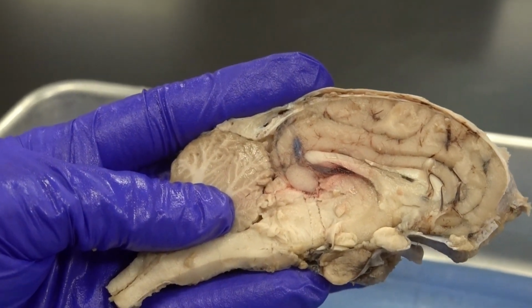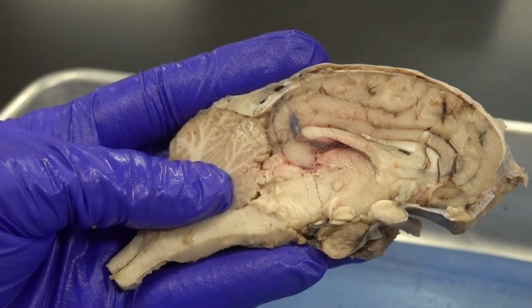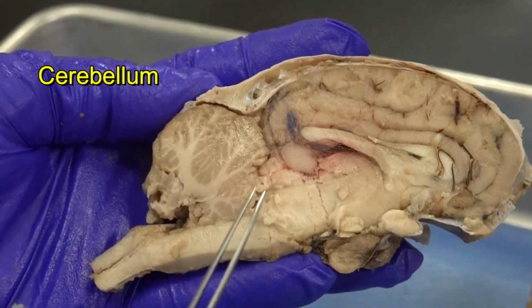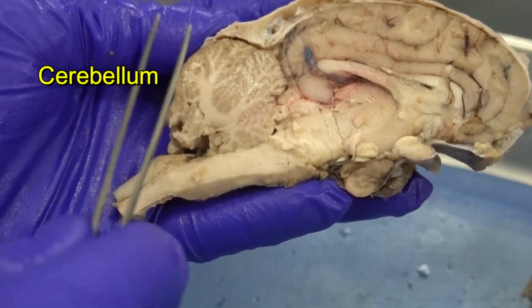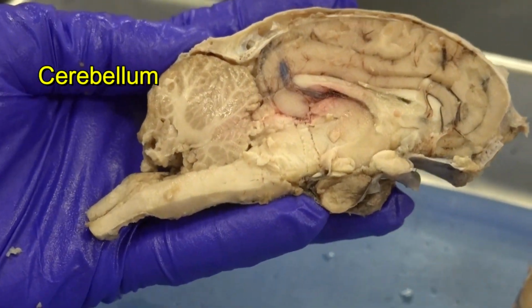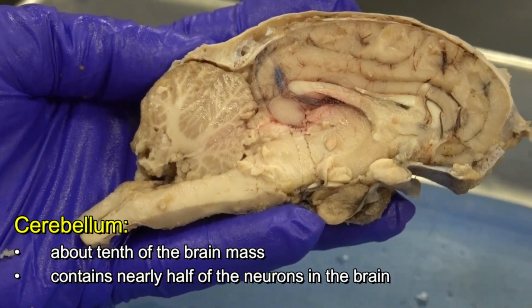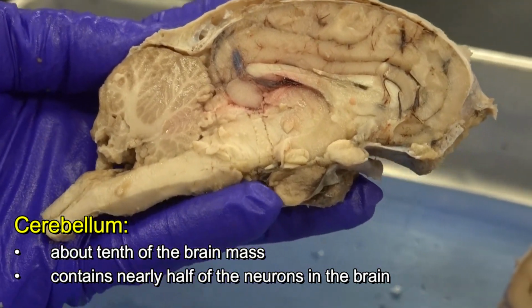Clearly, sheep is the type of animal that responds more to visual stimuli than auditory stimuli. Next, I move to the cerebellum. The cerebellum is about 10% of the mass of the brain, but it actually contains about half of the neurons that the brain contains.